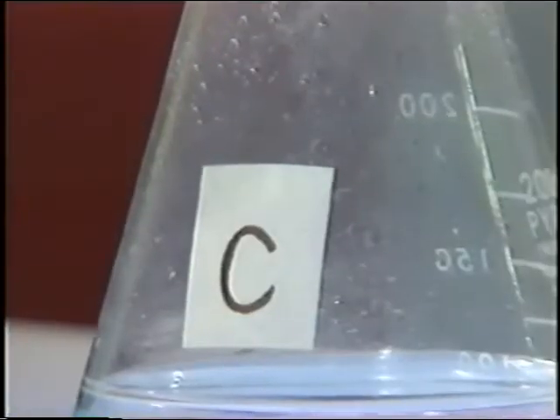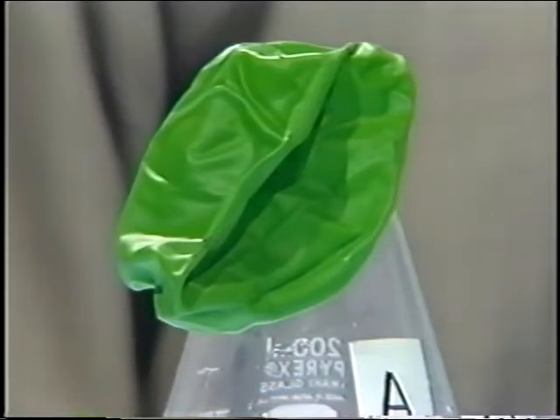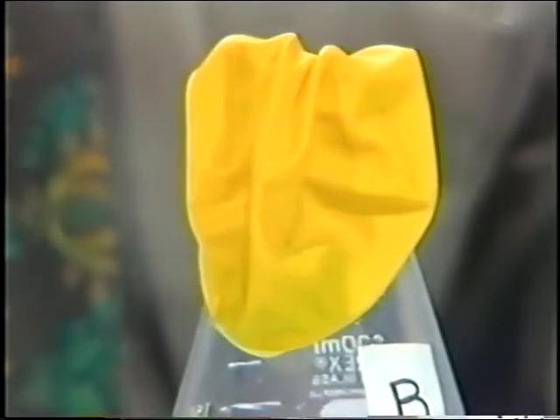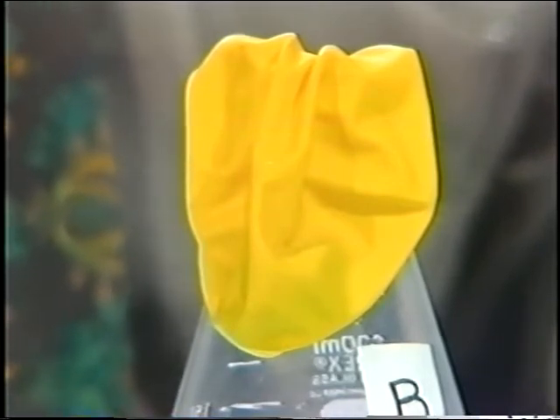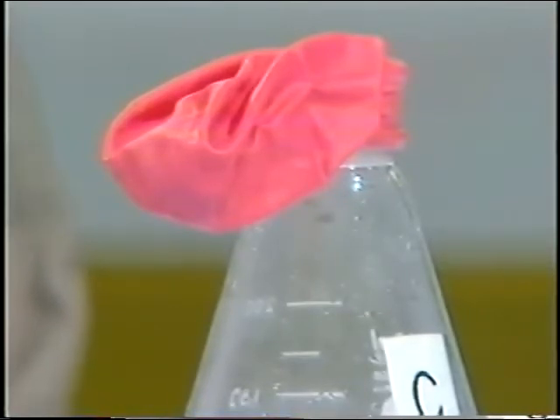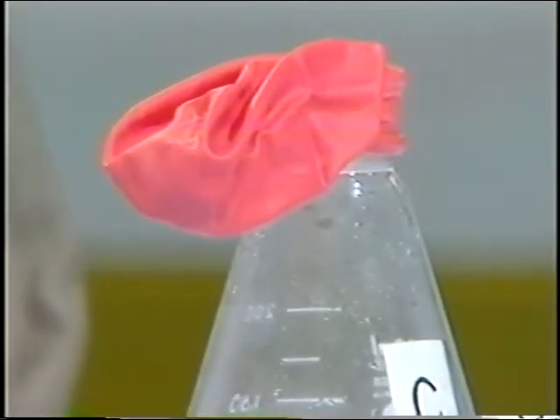Here are three flasks, each containing 1/10 mole of hydrochloric acid, labeled A, B, and C. The green balloon on flask A has 0.1 mole, or 2.4 grams, of magnesium. The yellow balloon on flask B has 0.05 mole, or 1.2 grams, of magnesium. And finally, the red balloon on flask C has 0.025 mole, or 0.6 grams, of magnesium.